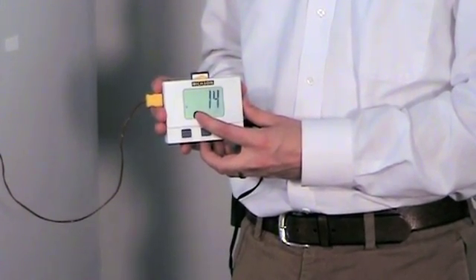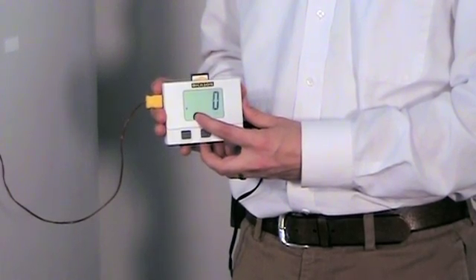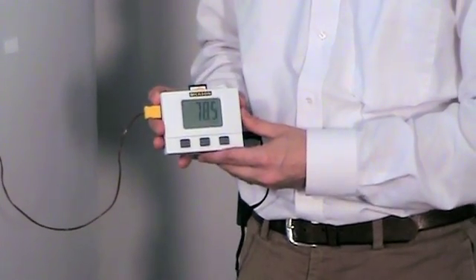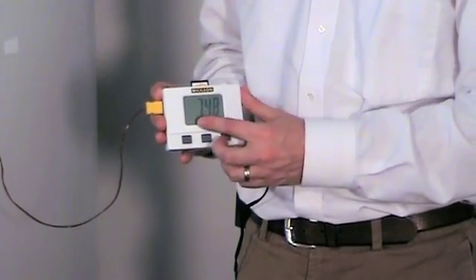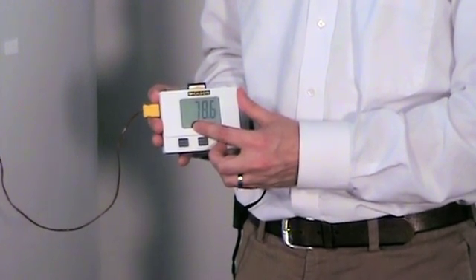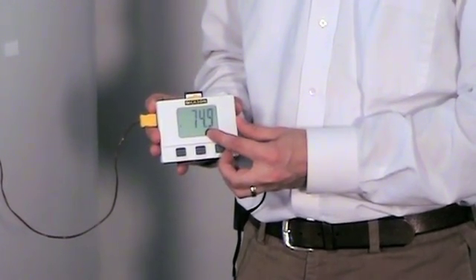Do not remove the card during this transfer period. When the unit is finished, store will disappear and the unit will show your current readings.